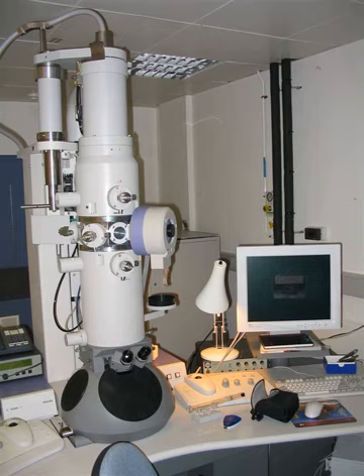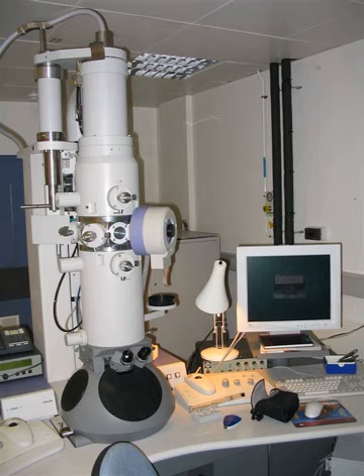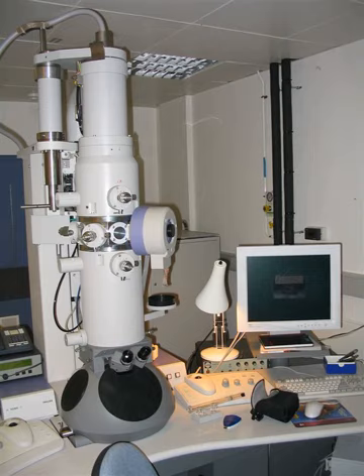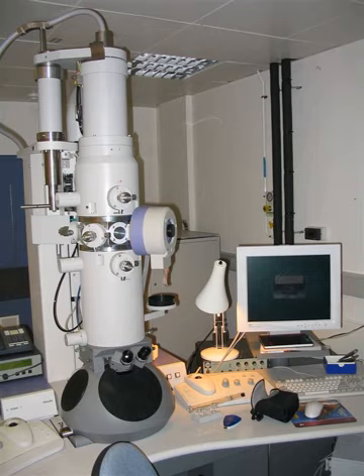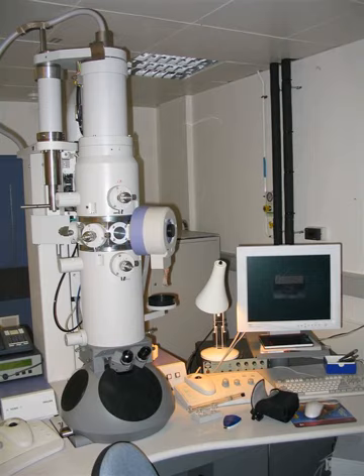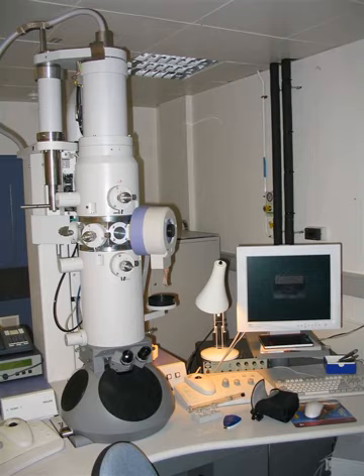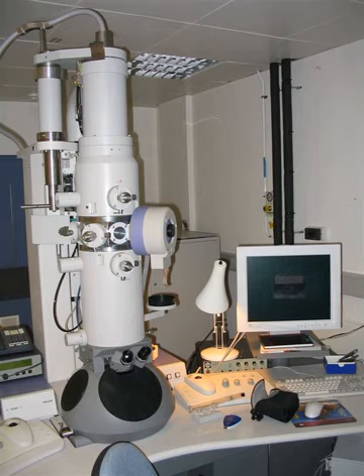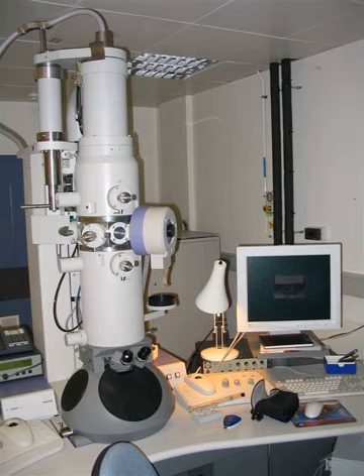The STEM rasters a focused incident probe across a specimen that has been thinned to facilitate detection of electrons scattered through the specimen. The high resolution of the TEM is thus possible in STEM. The focusing action occurs before the electrons hit the specimen in the STEM, but afterward in the TEM. The STEM's use of SEM-like beam rastering simplifies annular dark field imaging and other analytical techniques, but also means that image data is acquired in serial rather than in parallel fashion. Often a TEM can be equipped with the scanning option and then it can function both as TEM and STEM.